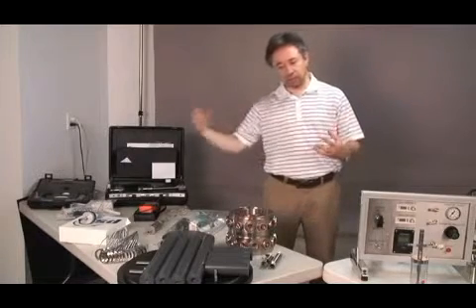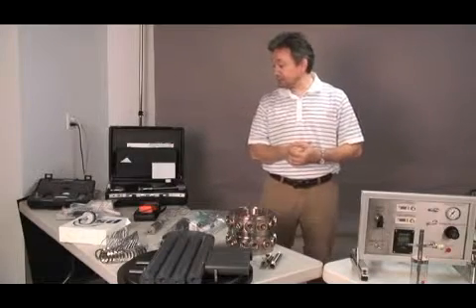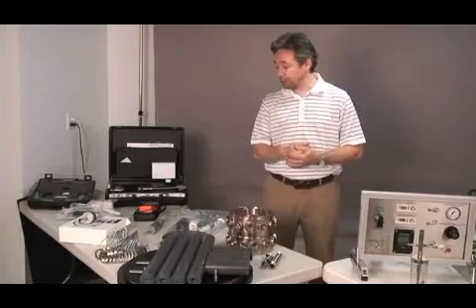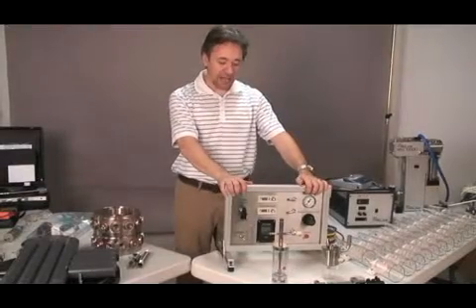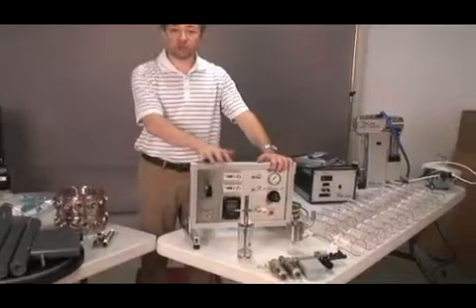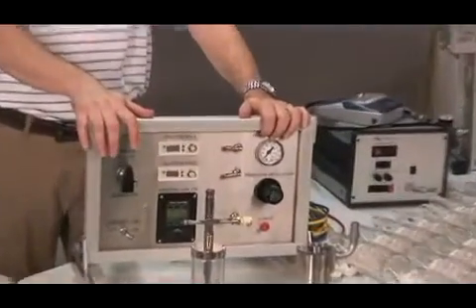So I was saying the tower sits on top of a rotating table that makes it easy to work with, load the tubes, work with the sampling devices, and basically make the exposure. The system is controlled by a manual panel that allows you to control the flow rates of the aerosol generators as well as the clean air needed for breathing.